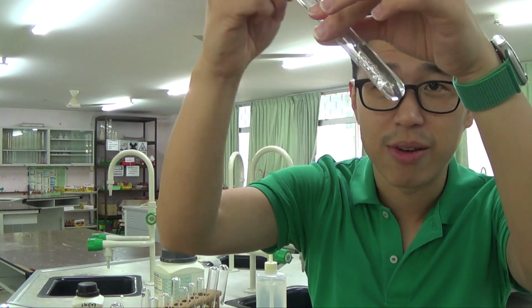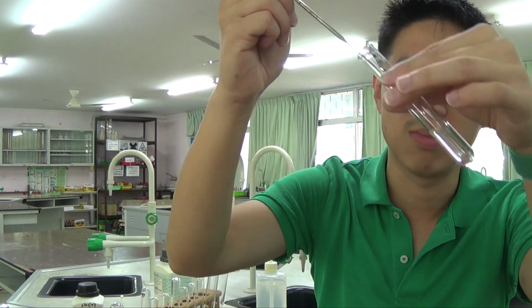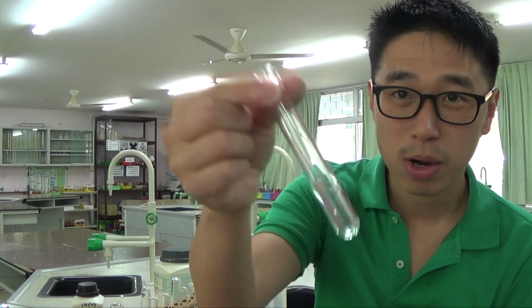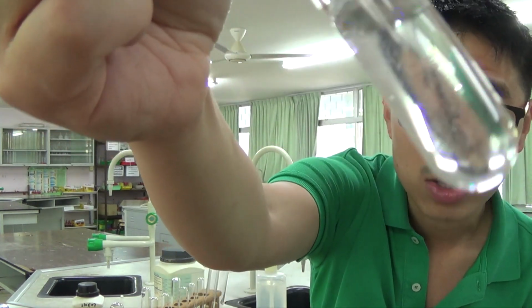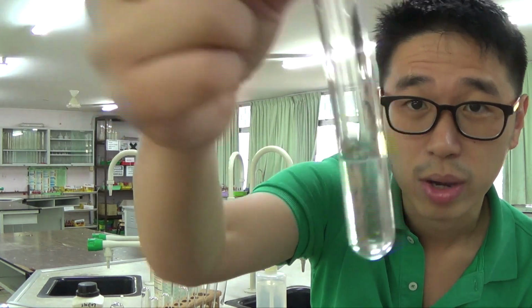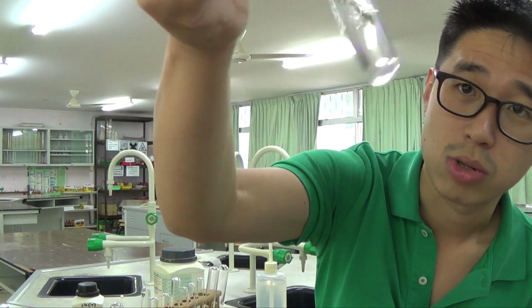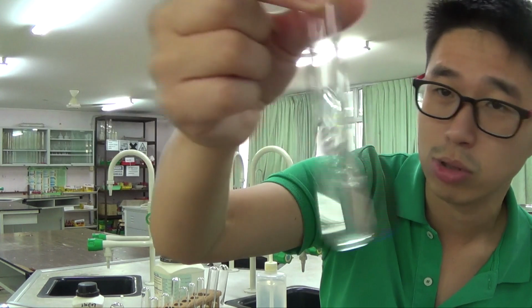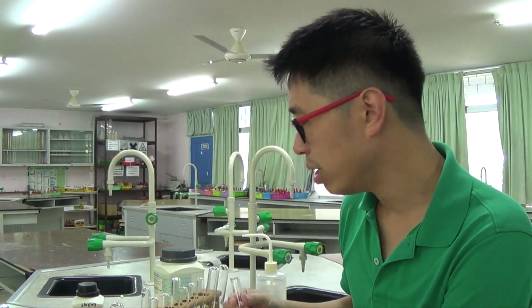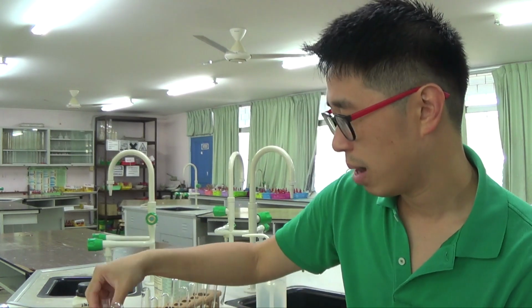Test tubes are very fragile, so I really shouldn't be using a spatula in a test tube, okay? Because they're very fragile. But as you can see, they're all pretty much soluble, so I'm not sure if the focus is going alright, but I can assure you it's all gone into solution. So this is ammonium carbonate. So let me test for ammonium carbonate. For the test for ammonium carbonate, you have to test for cations as well as anions.